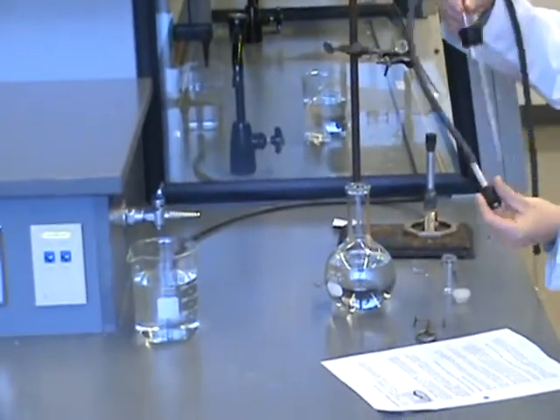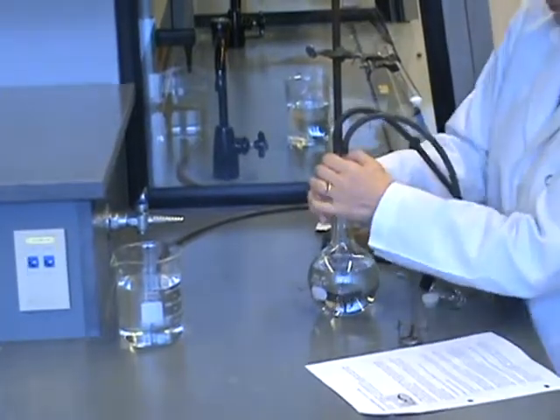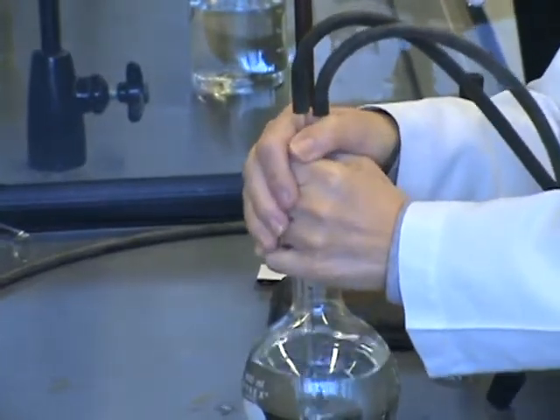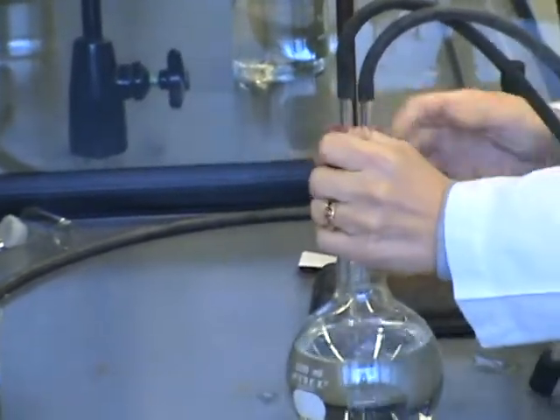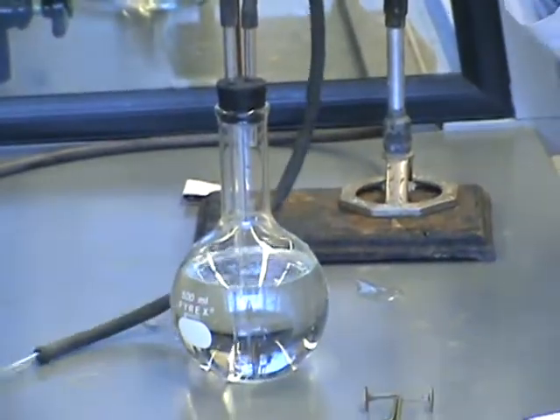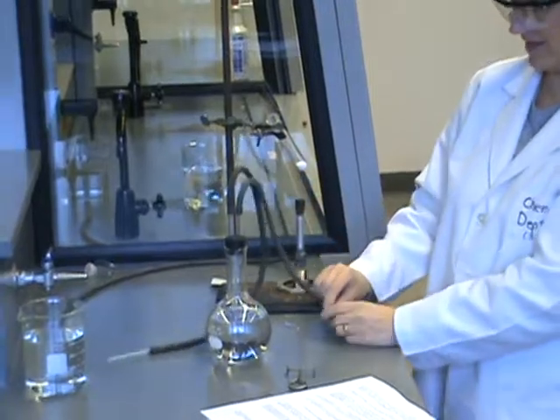This is your gas displacement unit. Put it into the flask firmly. You don't want it to pop off or leak gas during your experiment. This end will eventually go in the test tube but not yet. So just let it lay here.